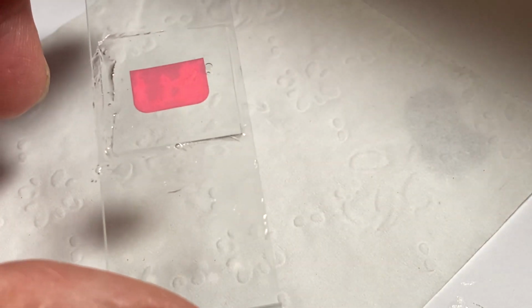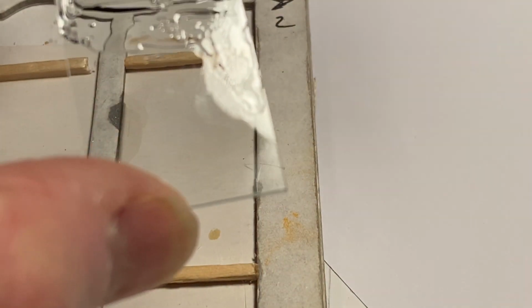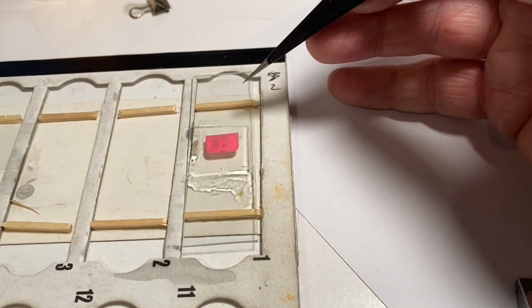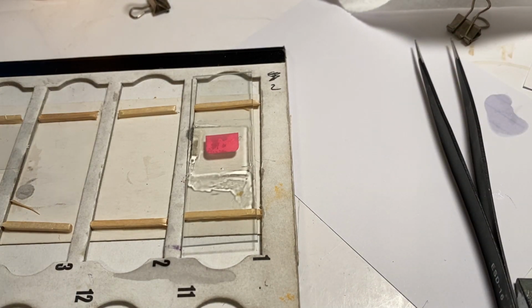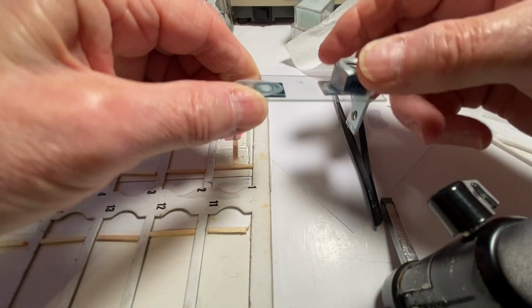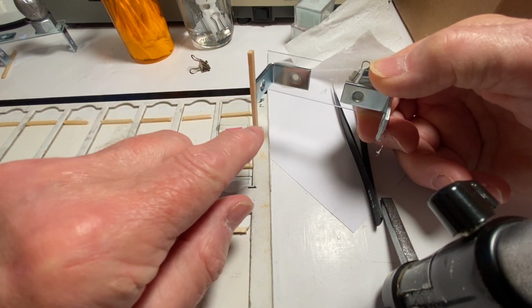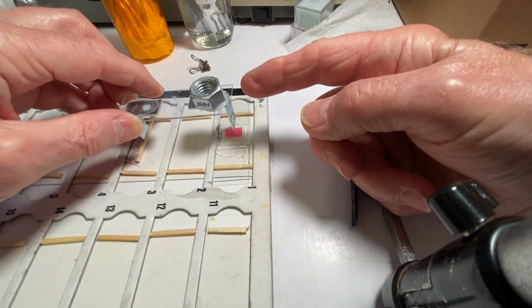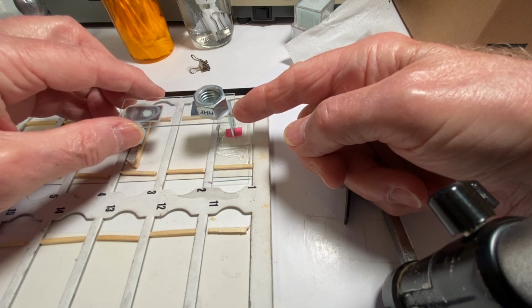And then the last thing I want to show you is we have to pretend this is an insect with a lot of bumps, etc. I made this little table here. I'm going to use a different magnification. Excuse me, guys. There we go. And if you notice, these two matchsticks, you can use anything on a piece of paper, two matchsticks glued. And then I made this device, which is a glass slide with an angle iron and the piece of wood there, which is a matchstick, angle iron glued onto the glass, and a weight. It's just a regular nut. And we're going to very gently lay the weight into the middle of the cover slip like that.